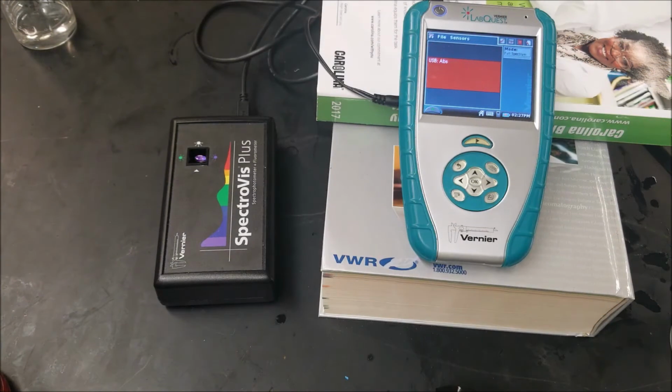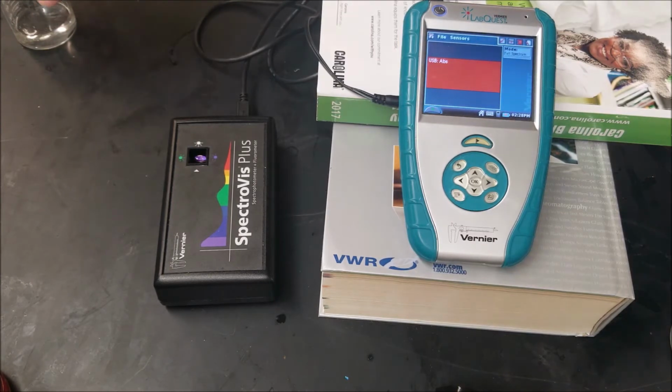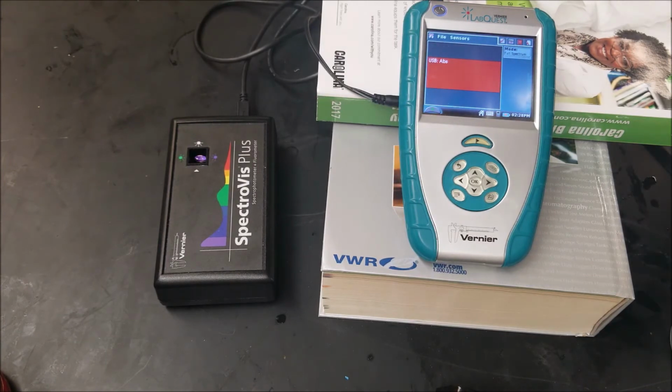Okay, I have this all warmed up. I need to calibrate this, measure the lambda max and the absorbance of all 5 samples at the various wavelengths. There is one error in the write-up. They ask you to calibrate this with deionized water, and that makes very little sense. We have not diluted this with deionized water. We have diluted this with nitric acid. So we are going to have our standard calibration with nitric acid.